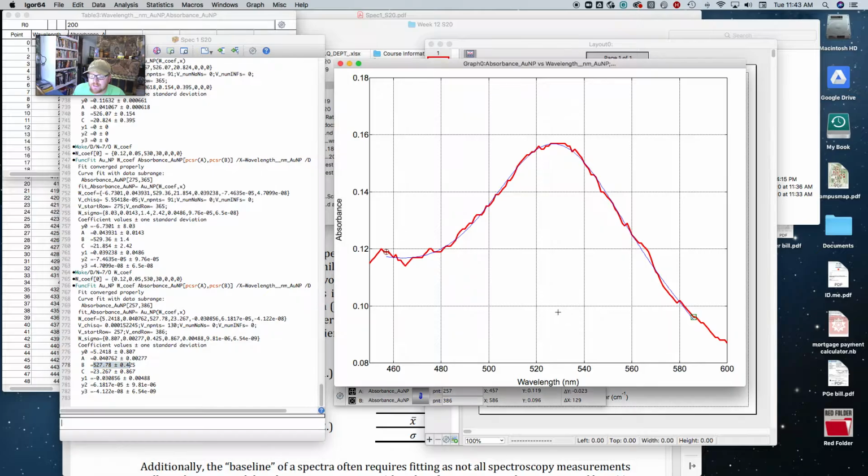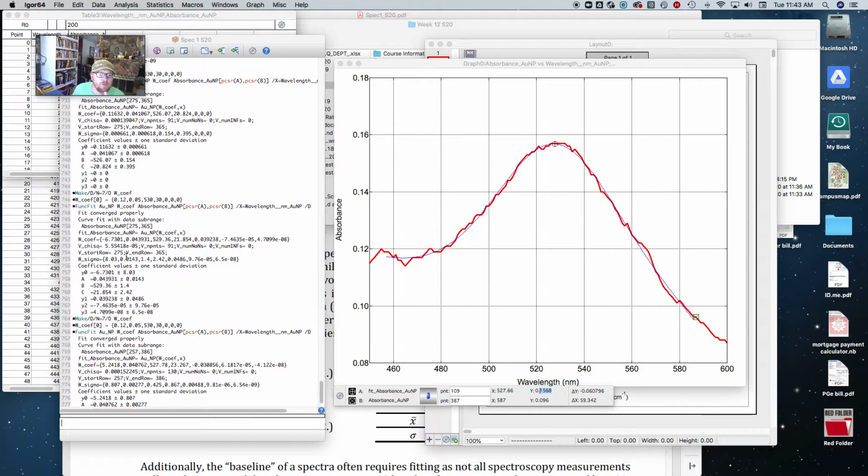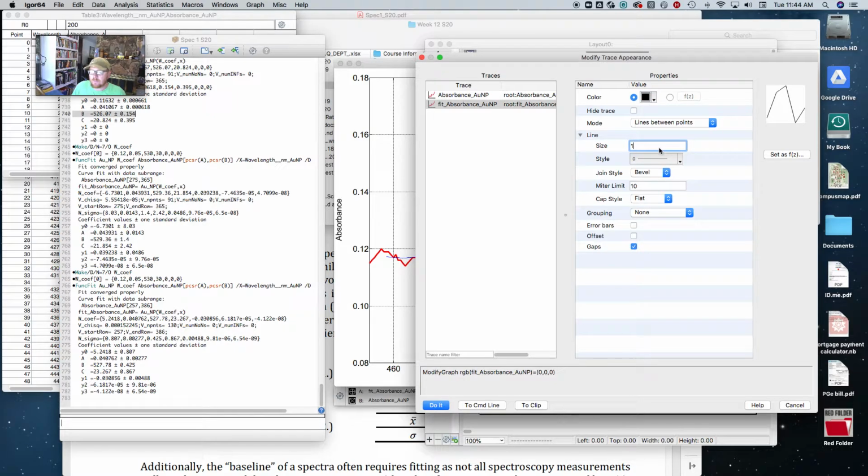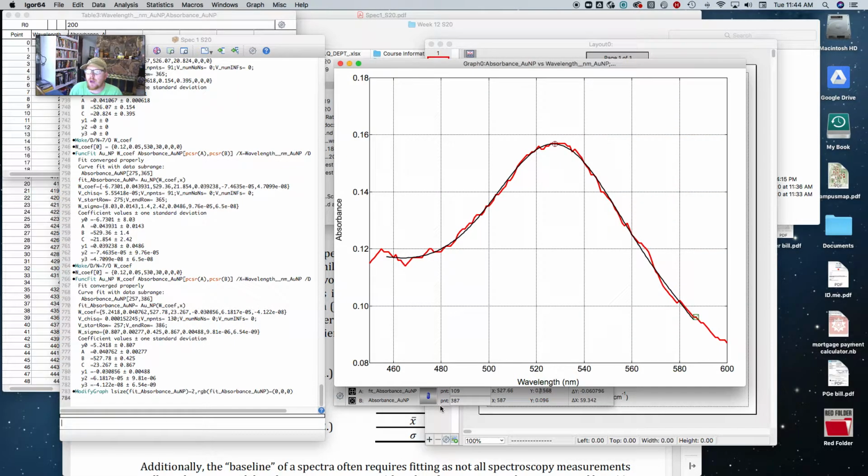And it's telling me the peak is 527. And that makes sense. I can put this thing at 527, and there you can see 527 nanometers at an absorbance of about 0.15. So that really makes good sense. And to confirm you're getting that 0.15 correct, it should be approximately, when we zeroed out all the values, I'll show you, right? This 0.11632 plus 0.04 is about 0.15. That was when I had all these other values zeroed out. So that's just a way to confirm. But the fact that this is fitting the data nice, I'll make it so we can see this better. Then that works pretty well.